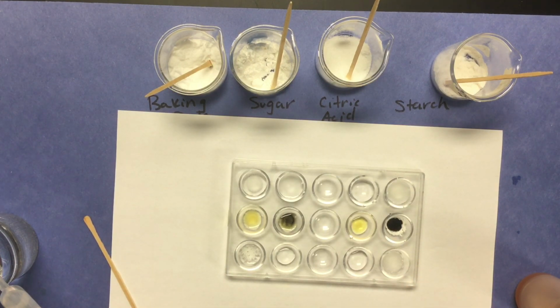All right, now for the mystery powder. Okay, so this one we don't know what it is. Put that one in the middle. Okay, does not seem to be crystally. I would say that that is a white fluffy powder. Let's add some water.